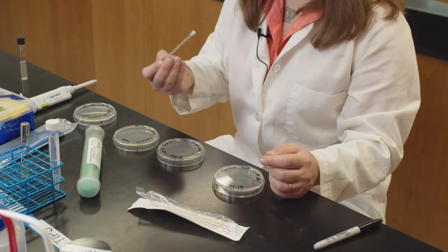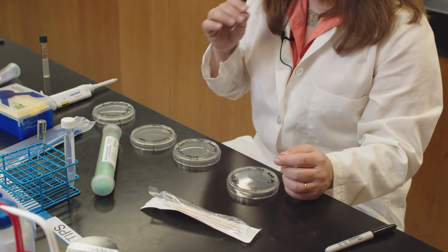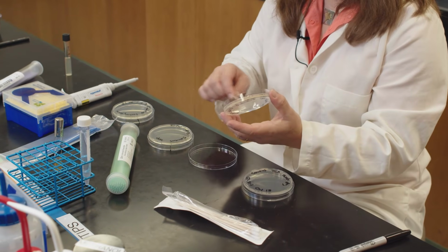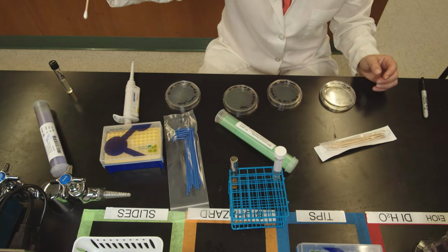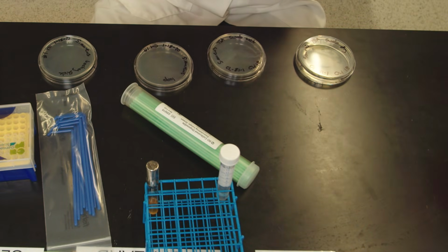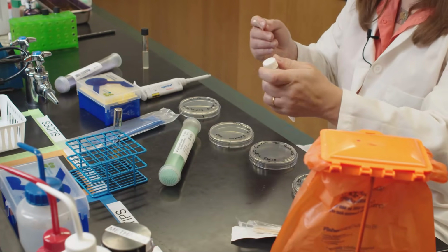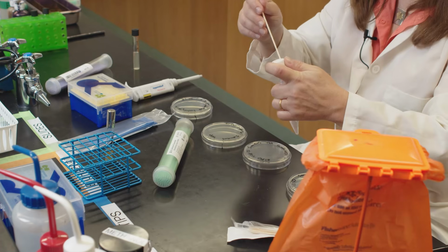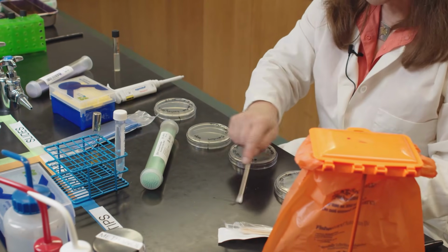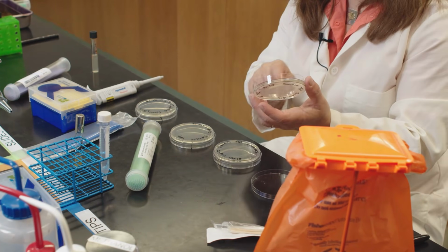If you have a wet surface, you can just inoculate your media with your cotton swab on a wet surface, which is my nose. And then you can just inoculate your media. Dispose in the biohazard. If you have a dry environment, it's best to pre-wet your cotton swab with sterile PBS. And you can, for example, swab the bench or the skin. And again, take the sample and inoculate your medium.